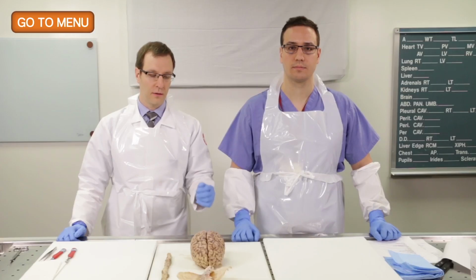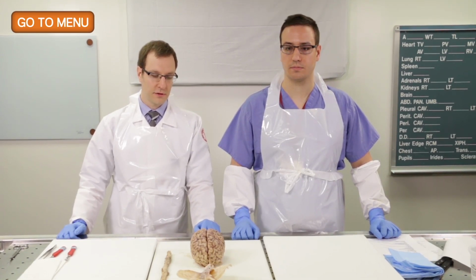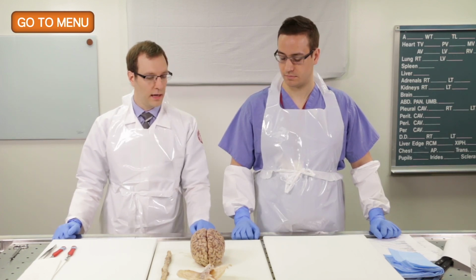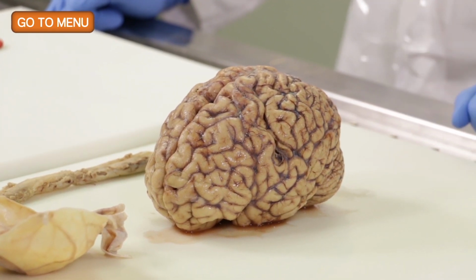So today we'll be focusing on a brain cutting that is associated with an autopsy. Typically the autopsy precedes the brain cutting by about 10 to 14 days to allow adequate time for the brain to fix in formalin. So the autopsy for this patient was performed a few weeks ago. And now we'll look at the brain and then we'll submit microscopic sections and that will complete the autopsy for this patient.